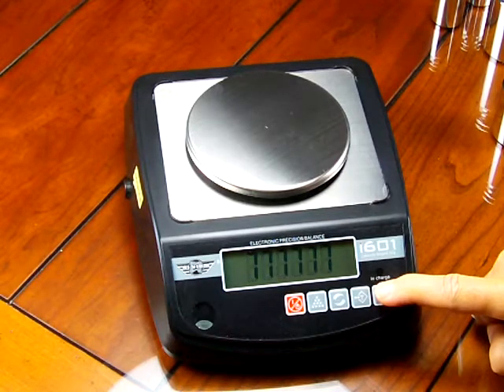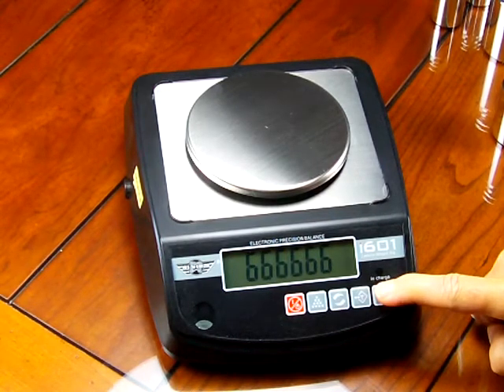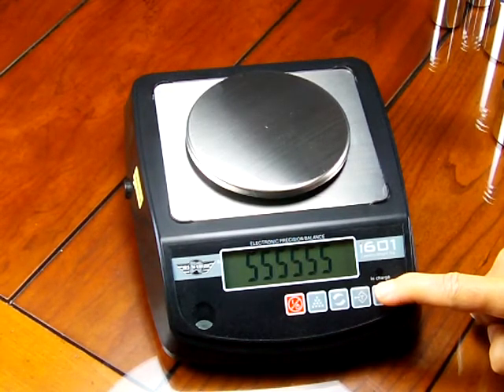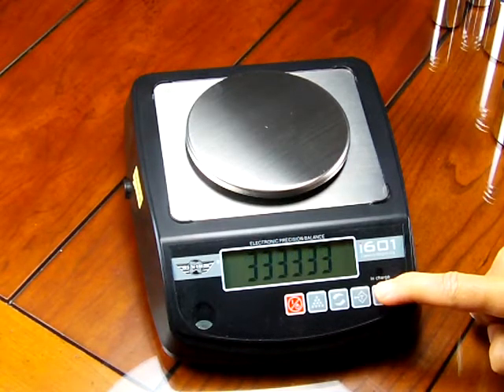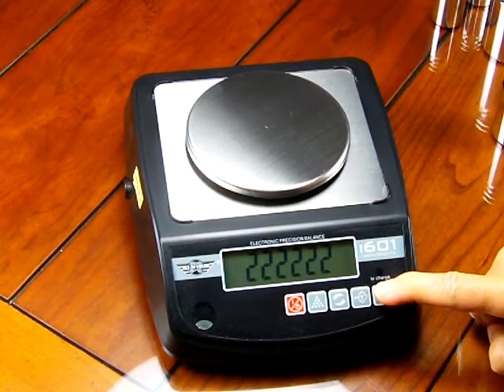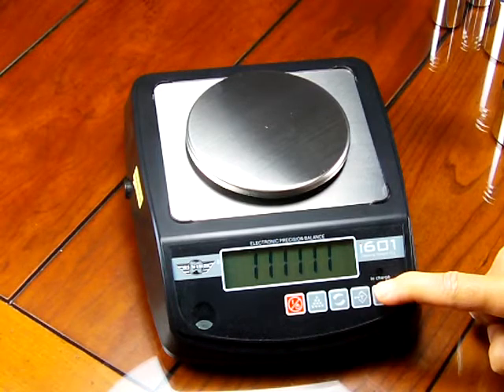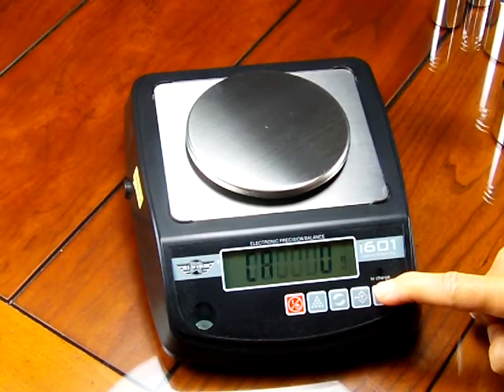So the scale is actually counting down, going from nine, seven, all the way down. And I am holding the zero key.